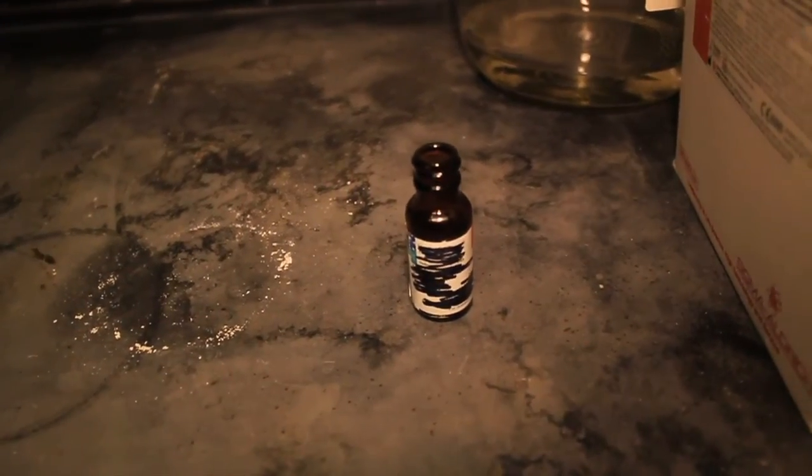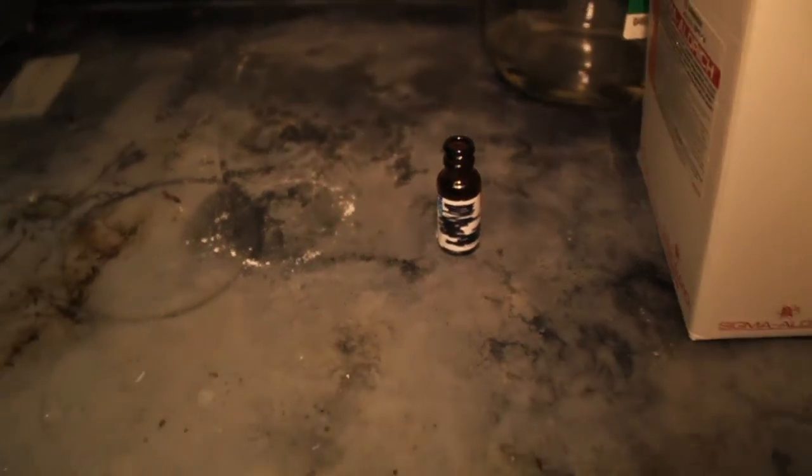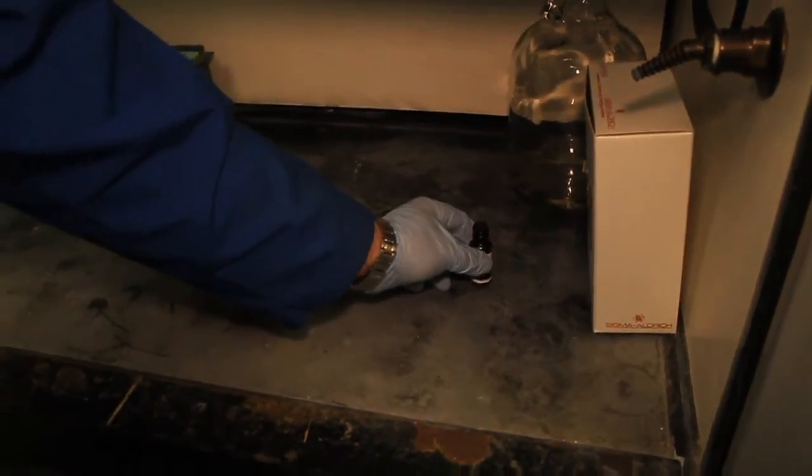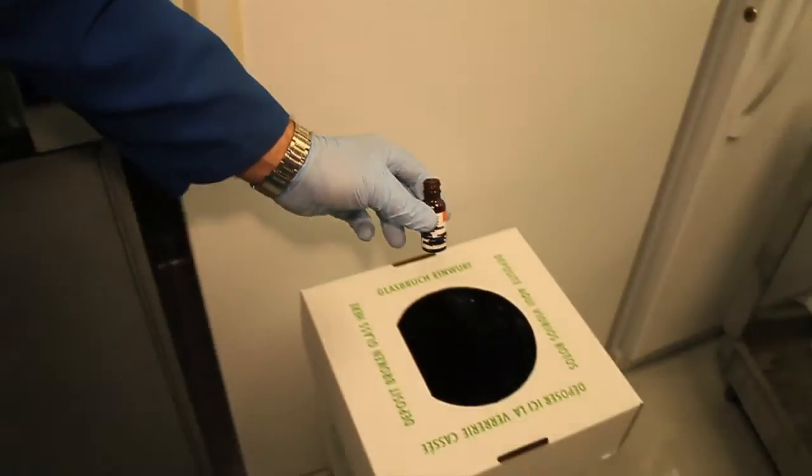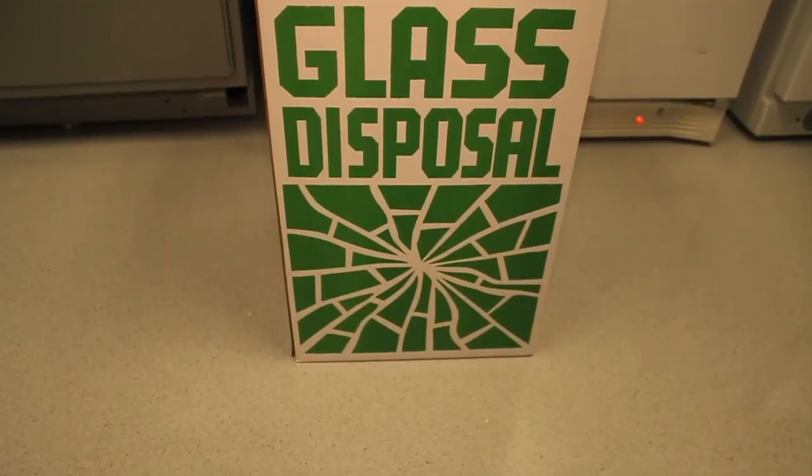Dry chemical bottles that have previously been washed, rinsed, defaced, and dried in the fume hood can simply be placed in the glass disposal box.